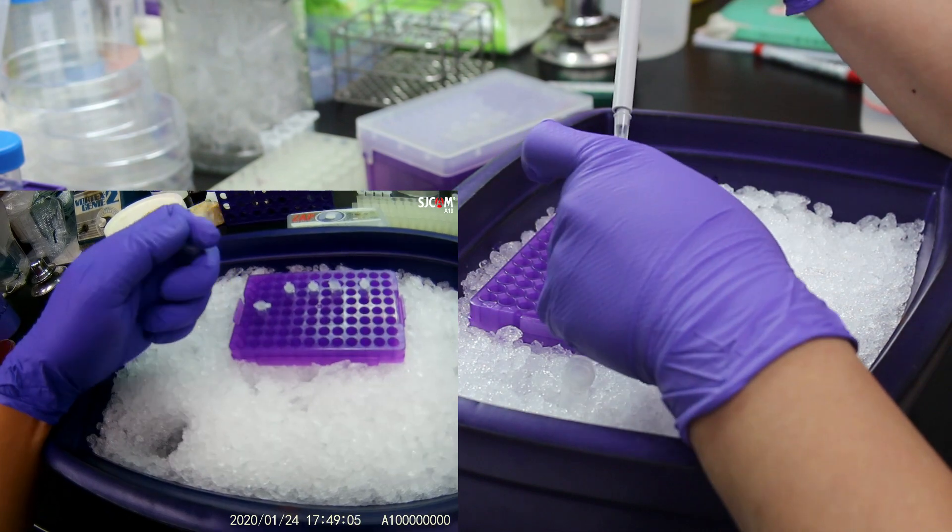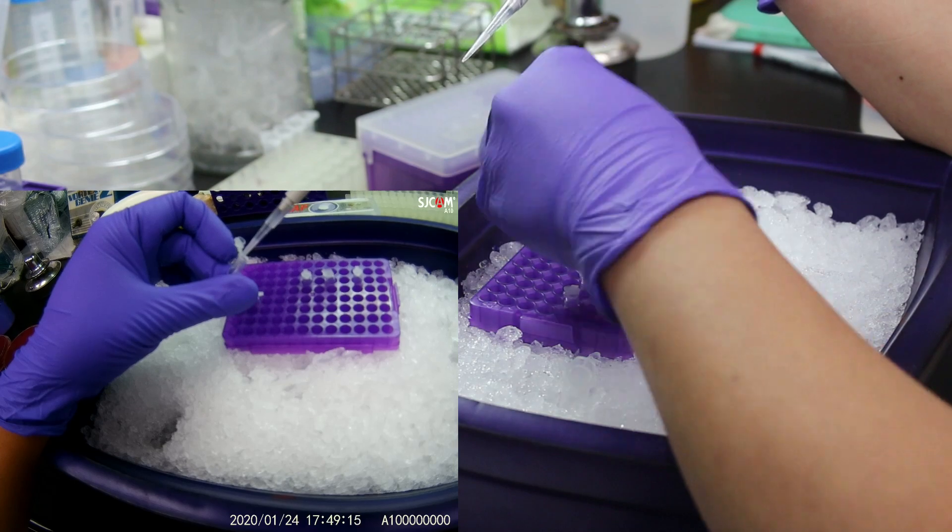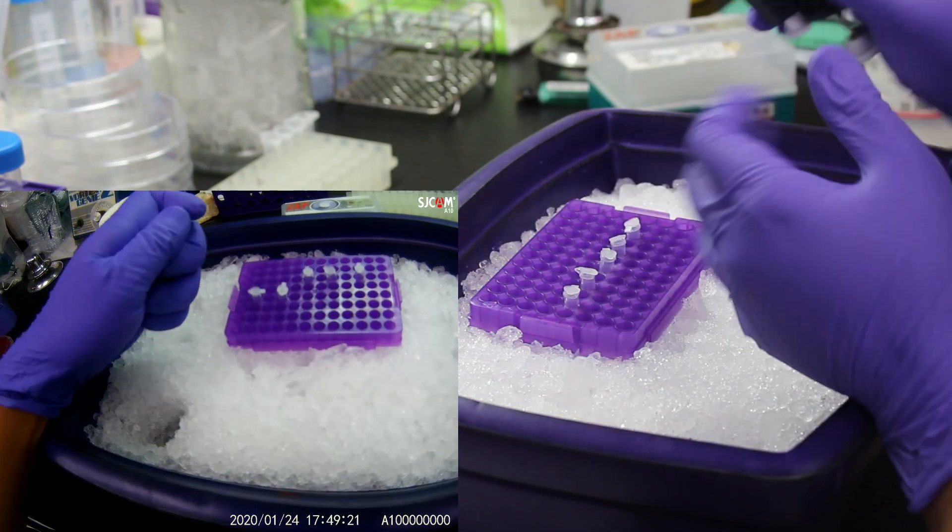Sometimes you will run into not enough mixture when it comes to the last tube, but don't worry. It will be used as negative control.